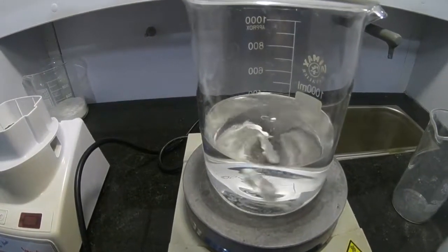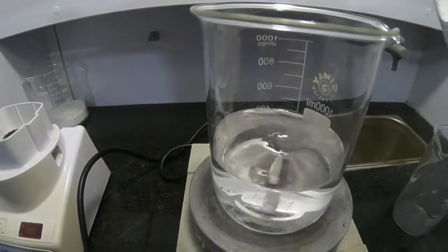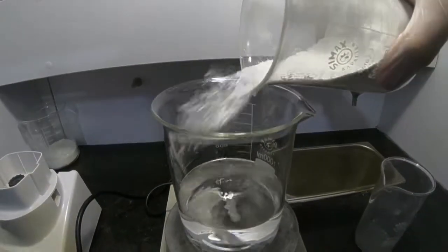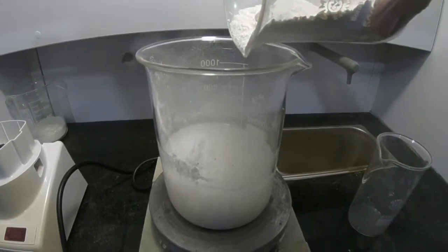Here I have around 400 milliliters of methanol. I'm going to add the powderized pills to this solution.